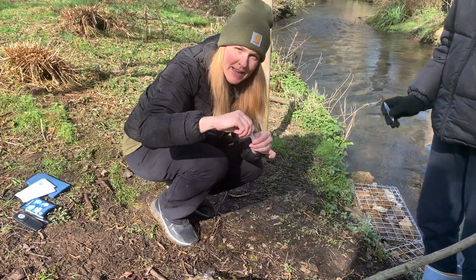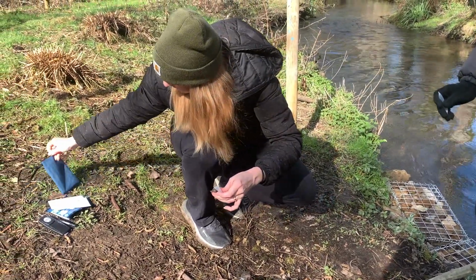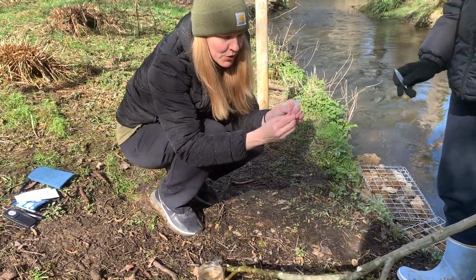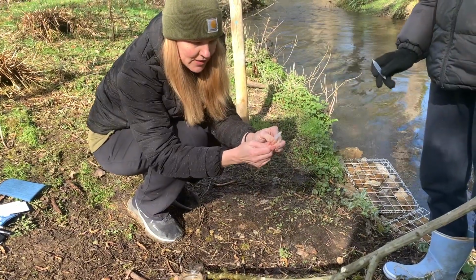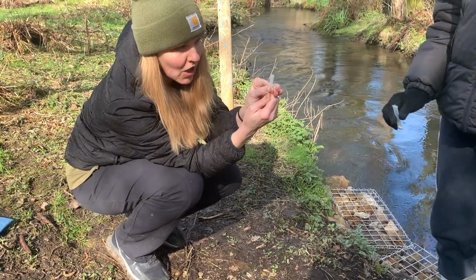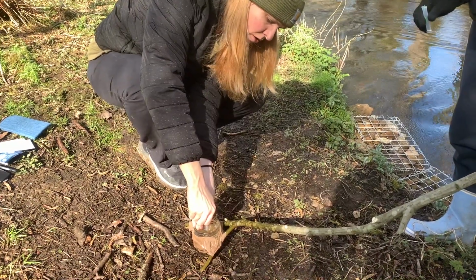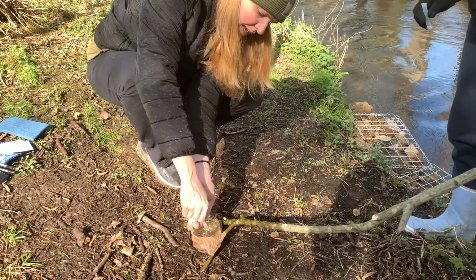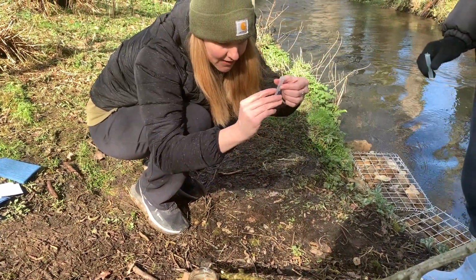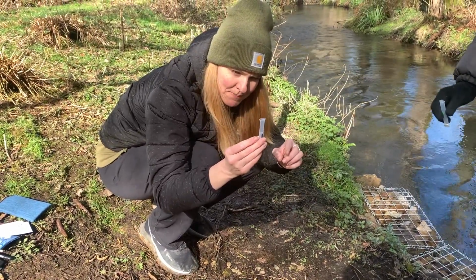We're going to take the little pin out. It can be slightly tricky. Put it in my little bag for now, and then you can recycle that when you get home. And then I'm going to use 2 fingers like this. You can see I'm squeezing this container quite a lot. Then I'm going to dip the top in, let go. It's going to suck up the water, kind of like a baster. So you can see I filled it just about halfway, just under halfway. So about halfway is where you want it.